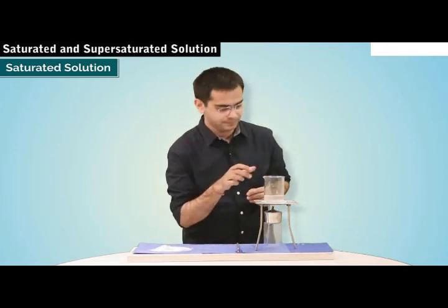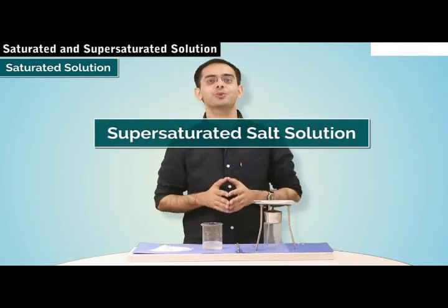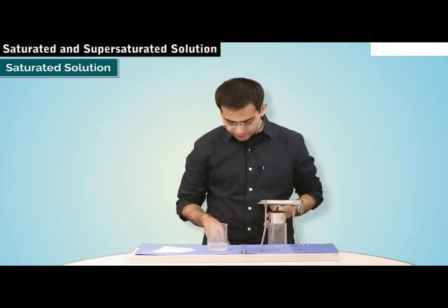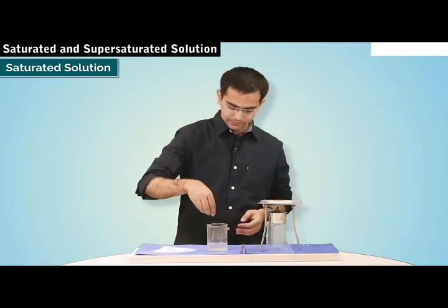And if we now allow this solution to cool, then the entire amount of salt will remain dissolved in the solution. So we leave it to cool down a bit. Now this is what we call a supersaturated solution. Now what will happen if we add a few crystals of salt to this cooled solution? Well, let's try doing it.